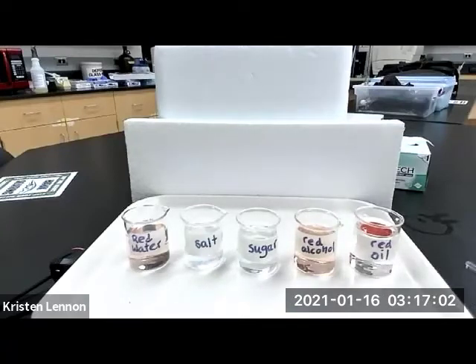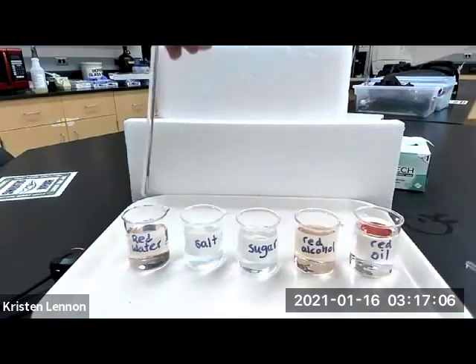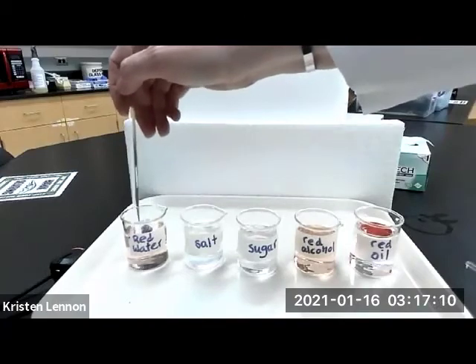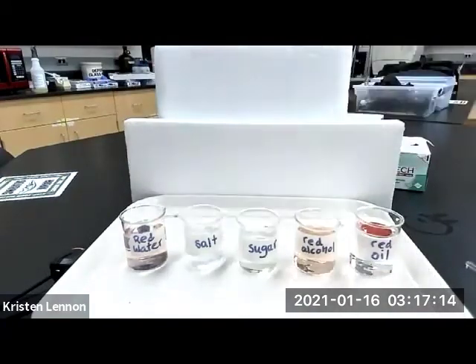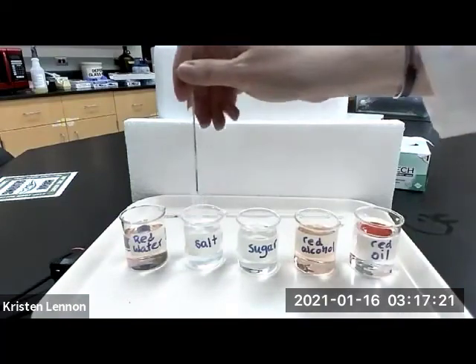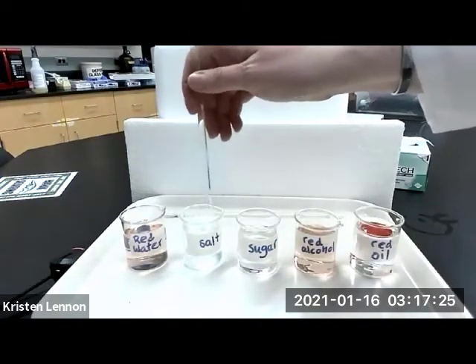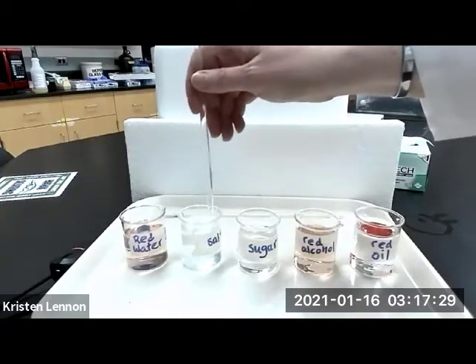So I have a stir rod labeled A, which goes with the red water. I have a stir rod labeled B, which goes with our salt. I can see the solid salt in there, so I'm going to stir it for a bit.